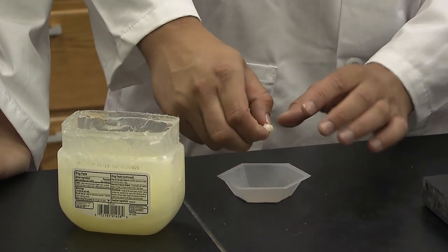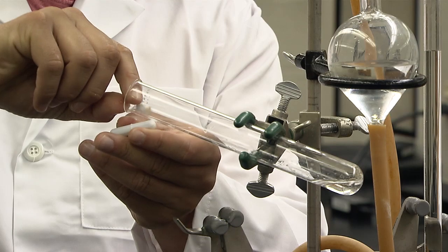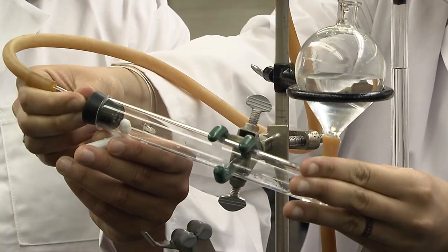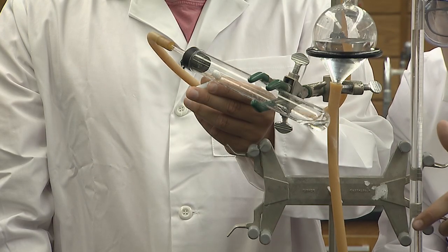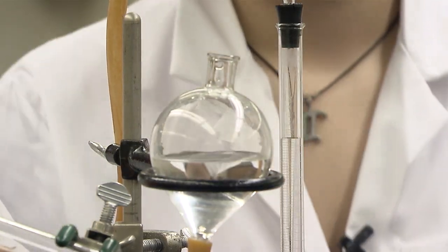The next step is tricky and requires coordination and cooperation between partners. Check. Hold the large magnet on the outside while gently placing the small magnet inside the test tube. When it catches in the magnetic field, I'll stopper the test tube. Once closed, the bulb is leveled with the burette. It looks like the first burette reading is 0.05 milliliters.